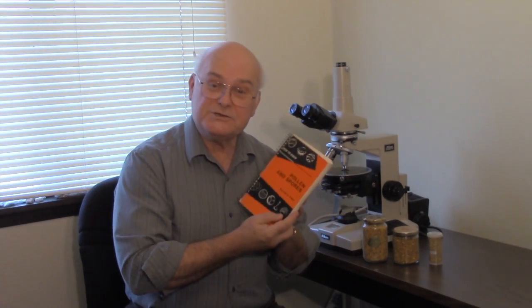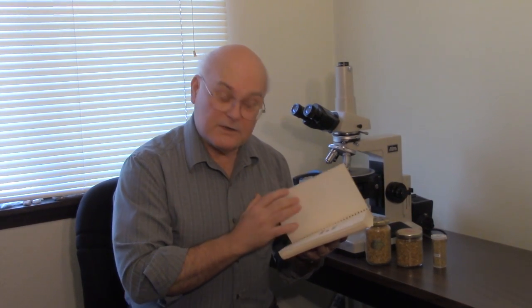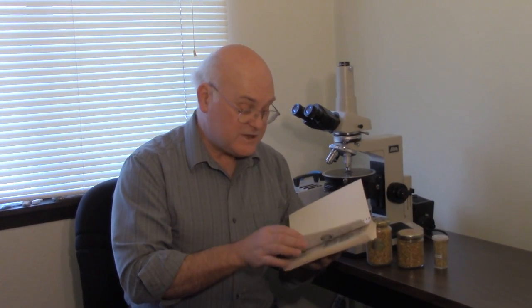Some of the keys to the identification of pollen take a particular set of characteristics and you have to identify those characteristics before you go on to the next step.